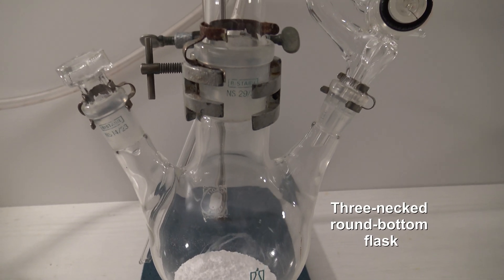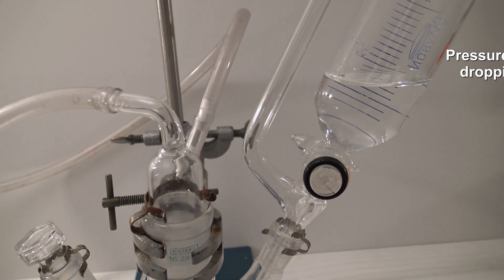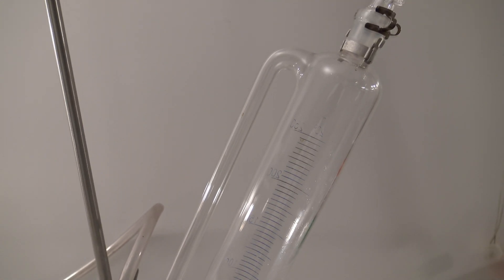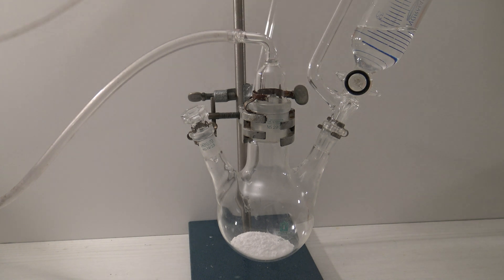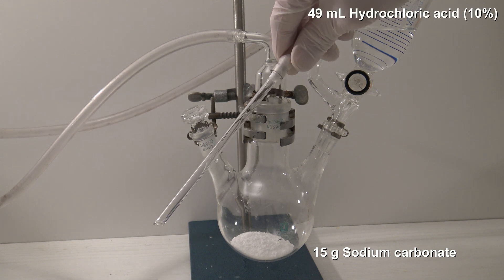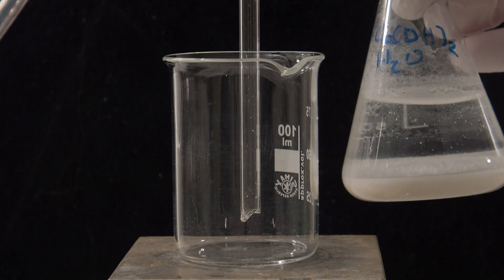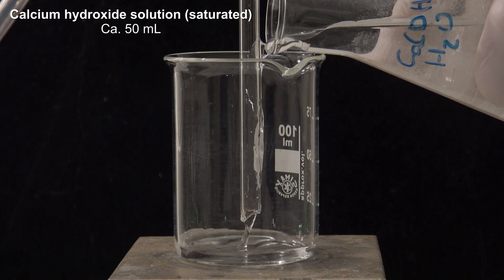To show this, an apparatus made of a three-neck round-bottom flask and a pressure-equalizing dropping funnel was used to prepare CO2 gas. The gas was passed through a hose and a glass tube. In the flask were 15 grams of sodium carbonate and in the funnel 49 milliliters of 10% hydrochloric acid. The glass tube was placed in a beaker filled with about 50 milliliters of a saturated calcium hydroxide solution.